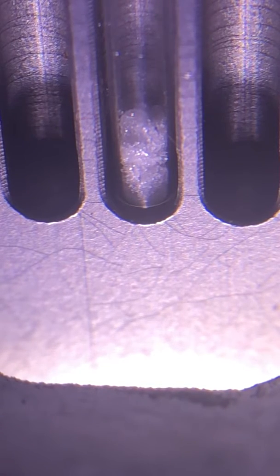So I'm going to start the heating. We're at 115.9 and I'll call out temperatures. I'll even zoom in a little bit, maybe we can see a little more clearly what the sample is looking like. We're kind of at the resolution of this camera. We're at 116.3.